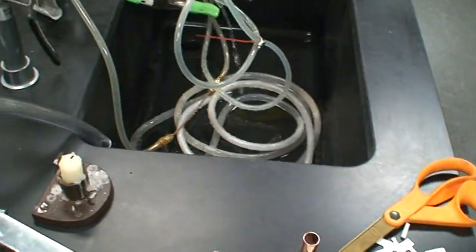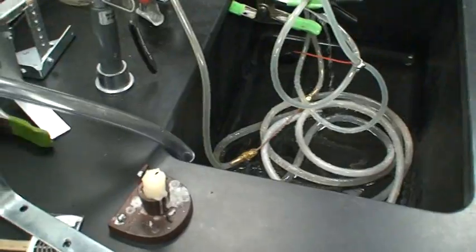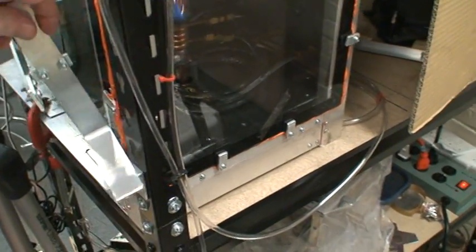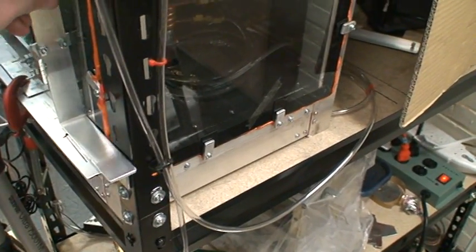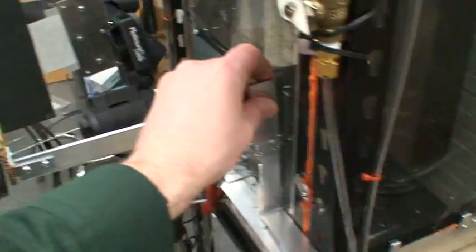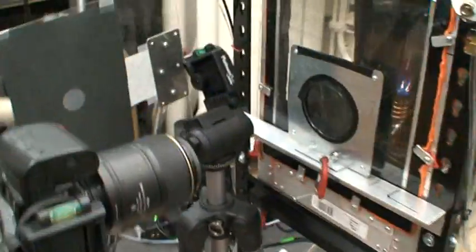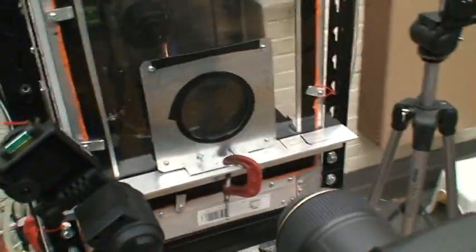And I also built a little mount that goes here. I don't want to put it in because the cover is not on the camera, but you mount this here and then it tells you where to put the camera lens so that you'll get the right image. So your camera will be in approximately the right place. It still needs some fine tuning once you line it up with this little housing.